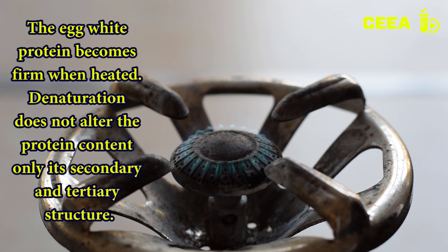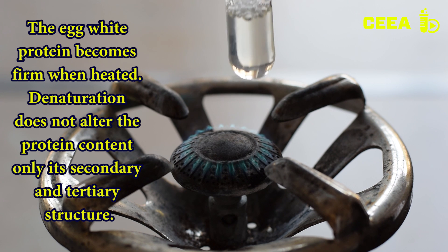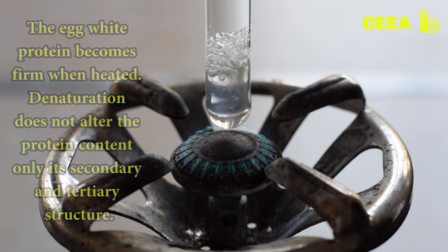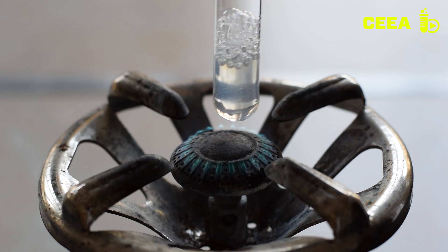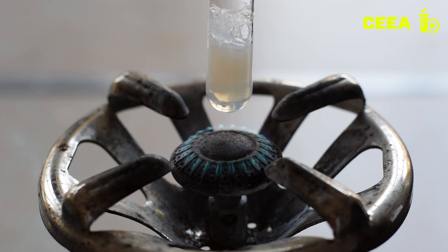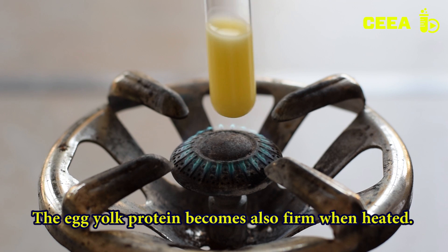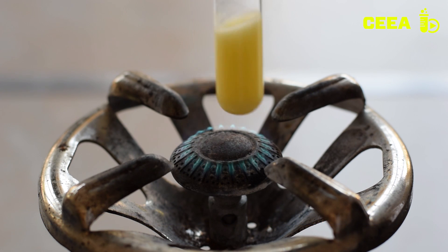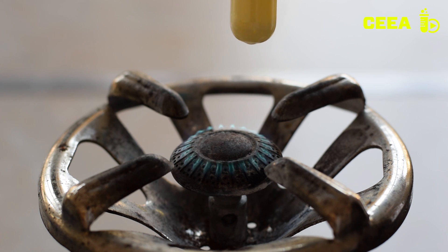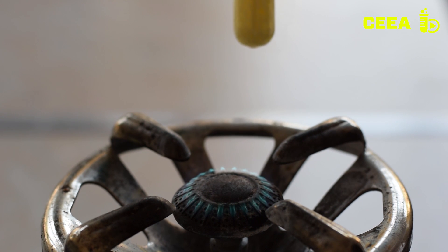Take a 3 ml sample of egg white protein solution placed in a test tube and heat it over a flame. The white color and the coagulation of the solution suggest that denaturation of the protein occurred. Repeat the experiment with the egg yolk solution and observe the coagulation due to heat.